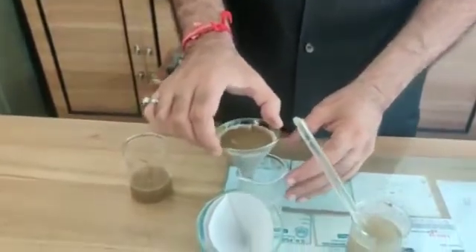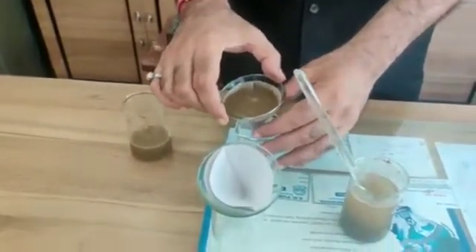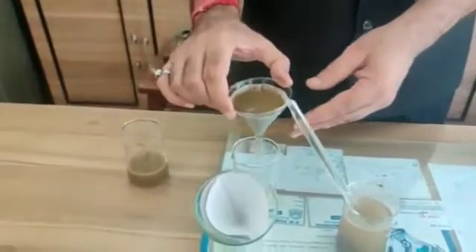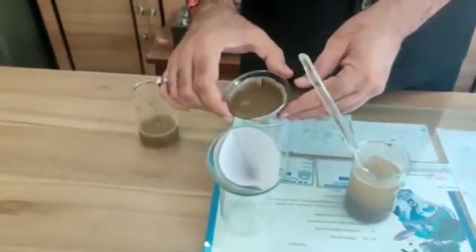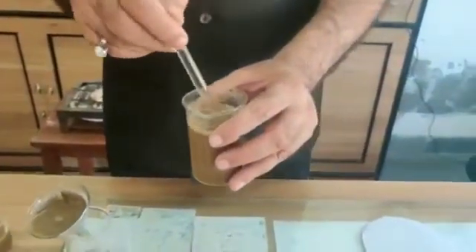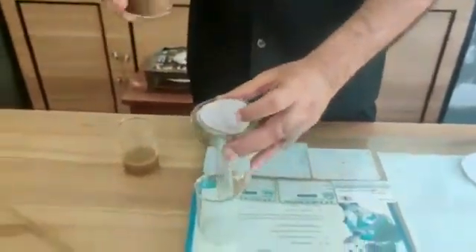I am keeping it for some time, let it settle — it will take a little bit of time. Now this is Sample B. Mix it well and pour Sample B into the funnel with filter paper B.